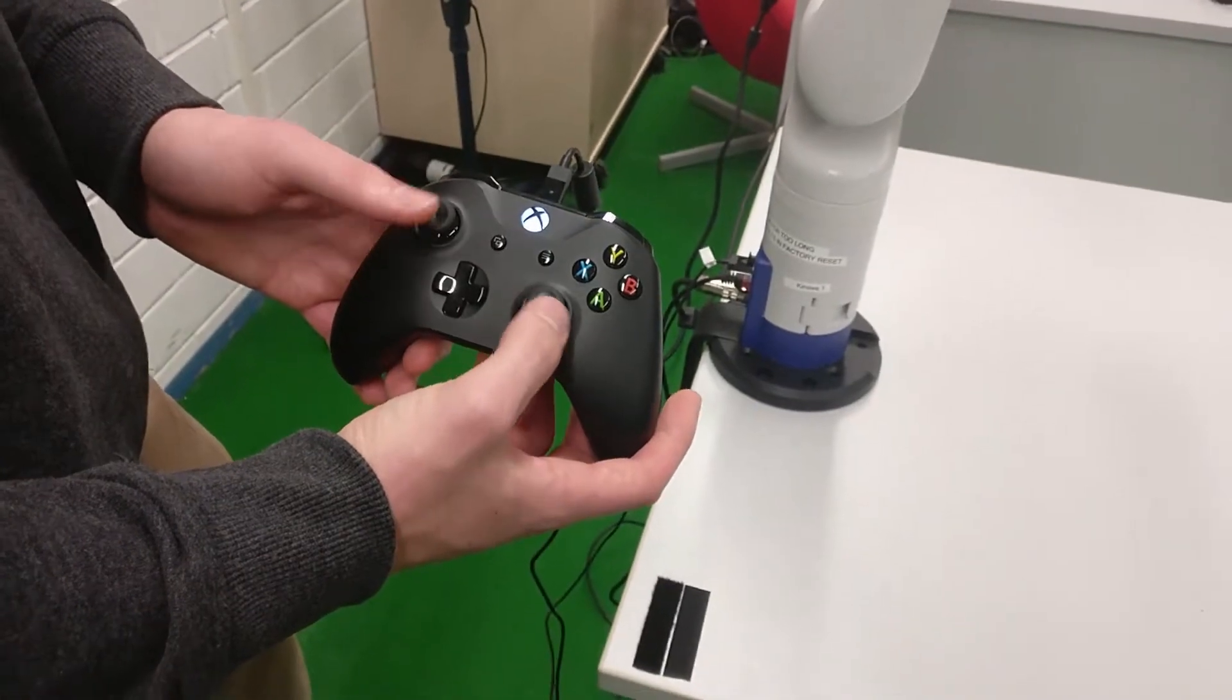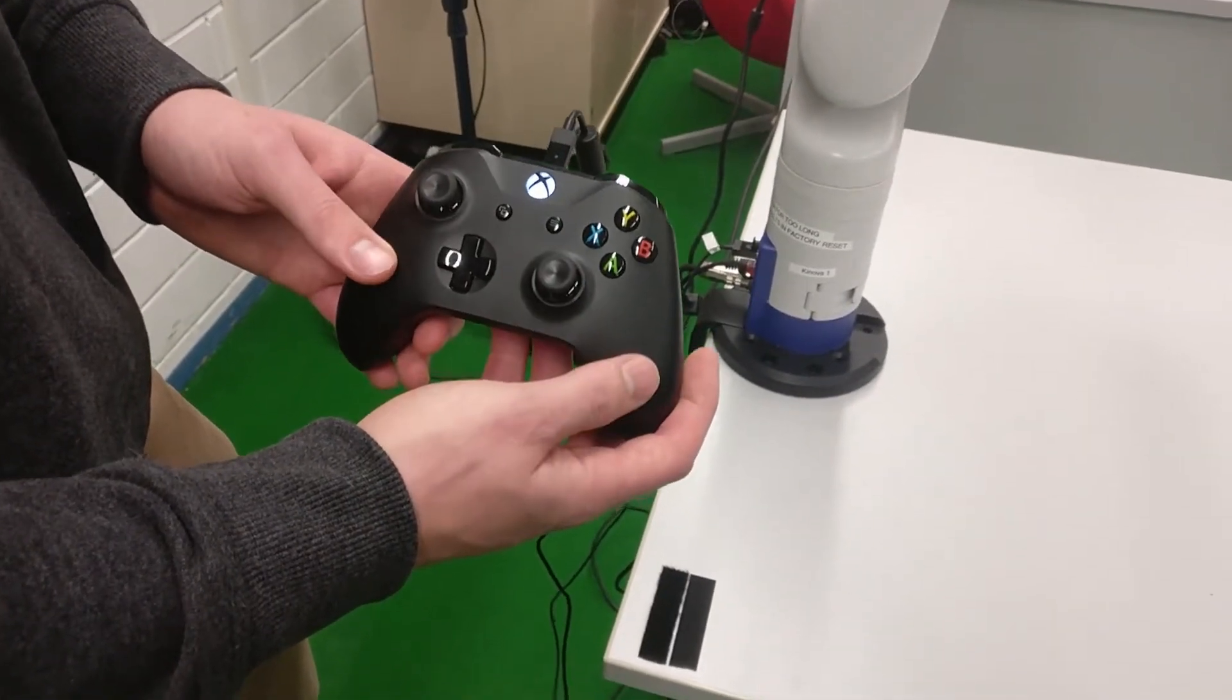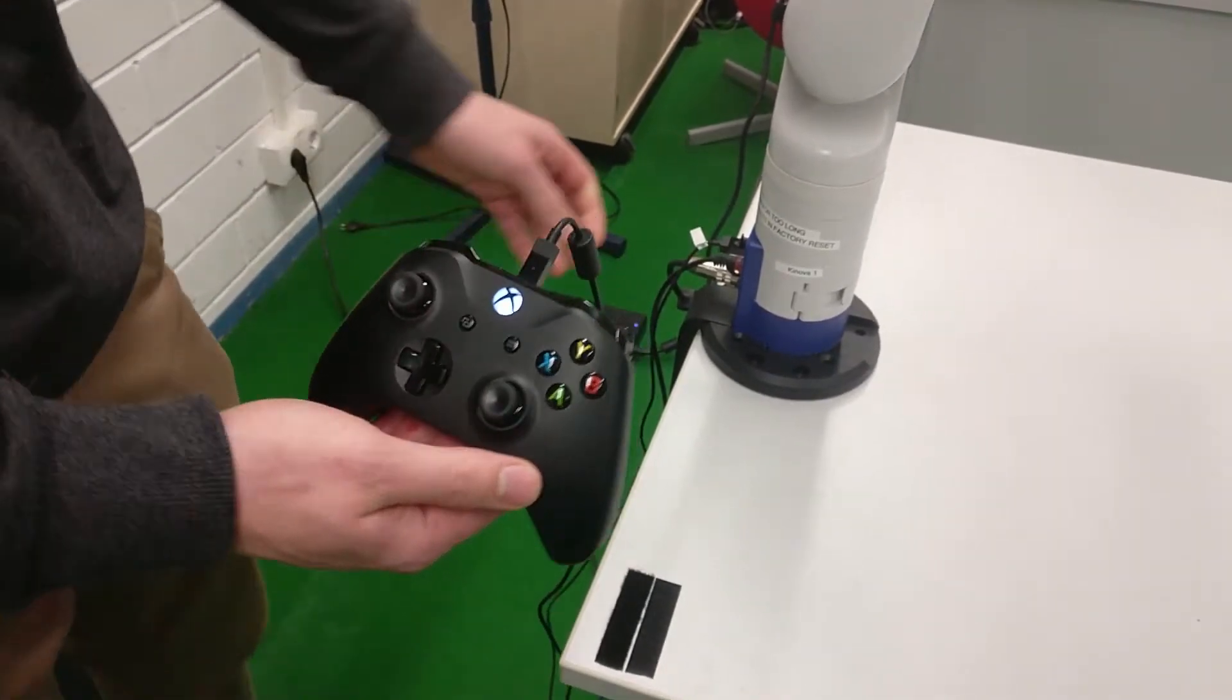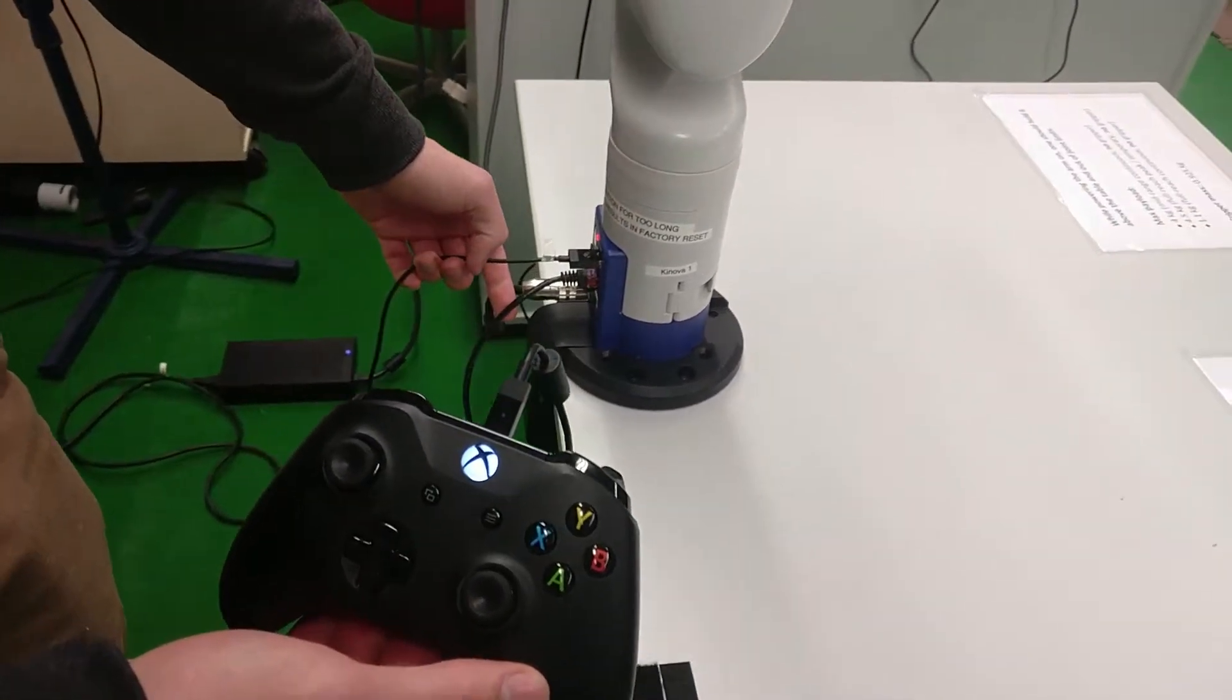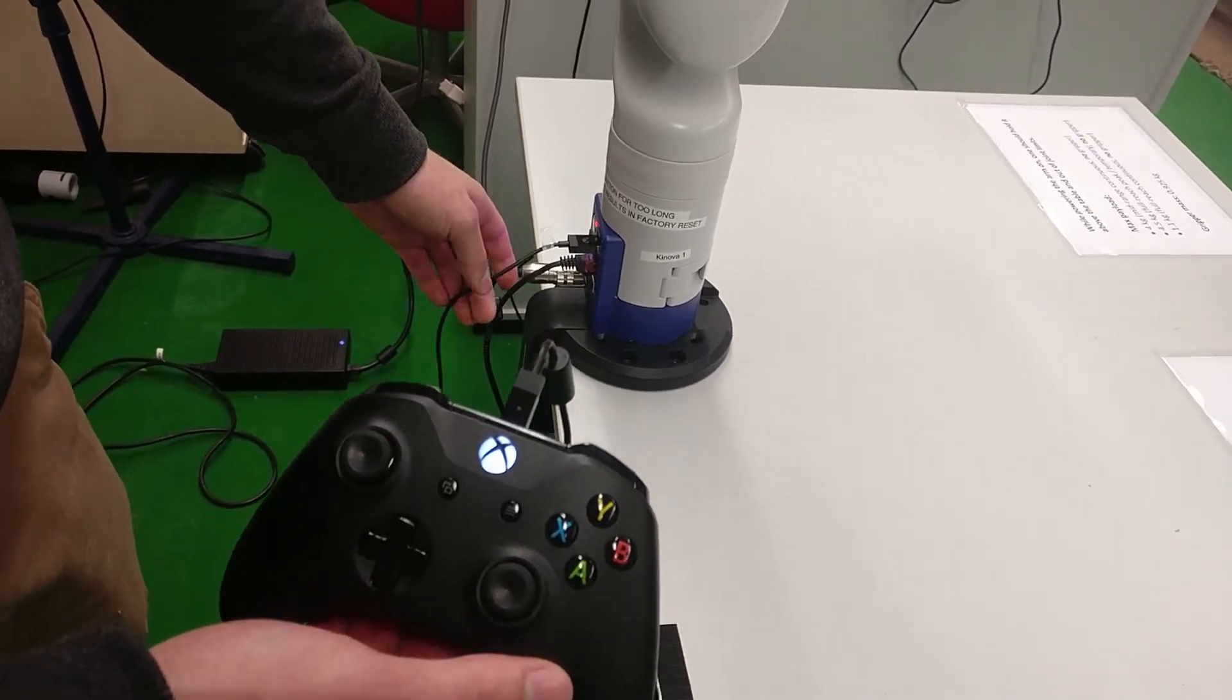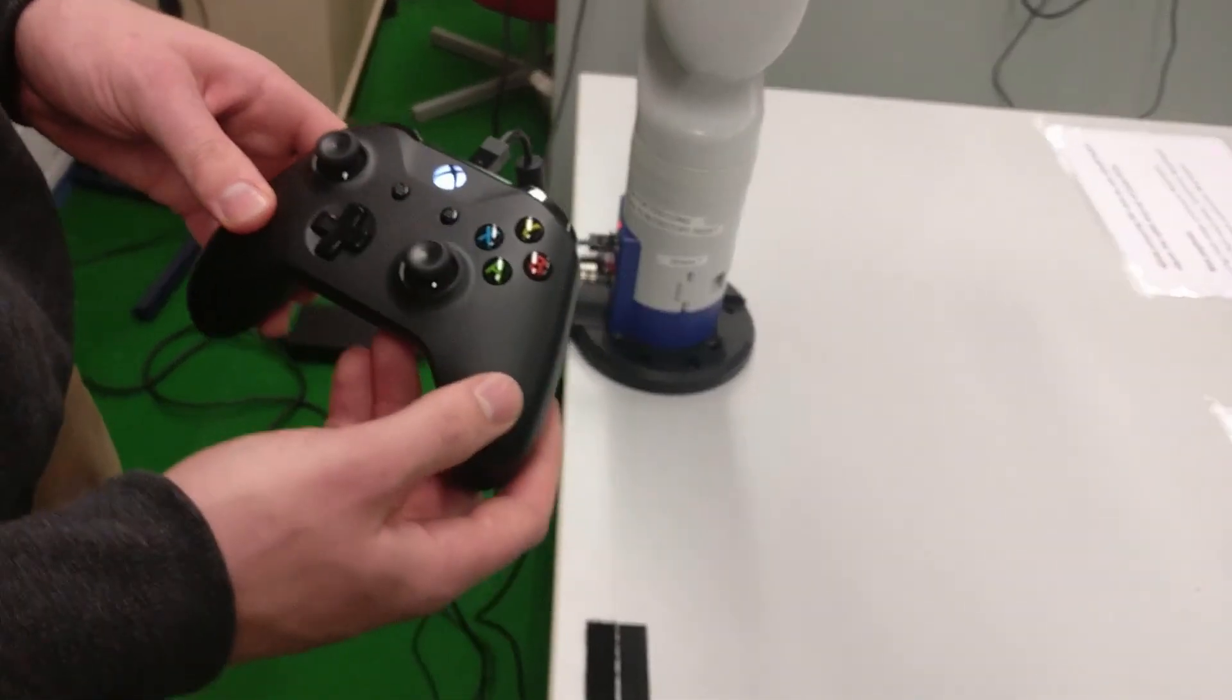So the controls are quite basic, using the joysticks to control it, but for more details on this, look at the official user manuals. Also for software control, look at the user manuals for more details on connecting and using the APIs and software. Thank you.